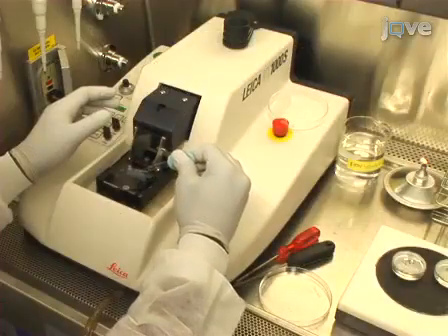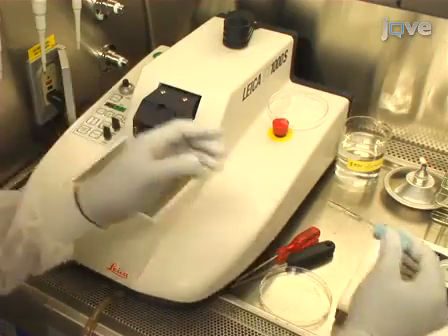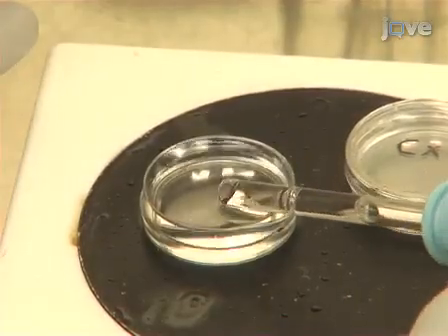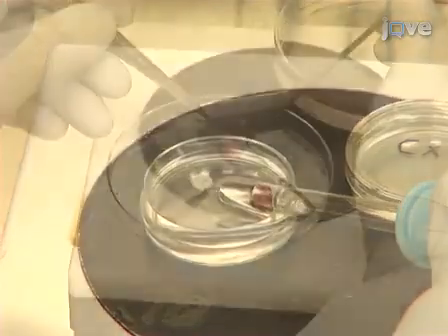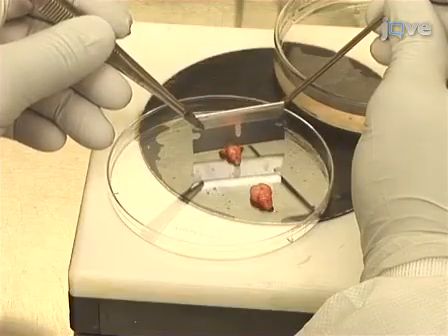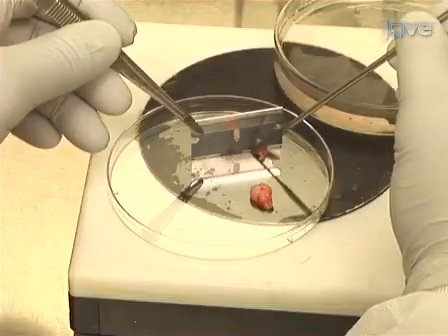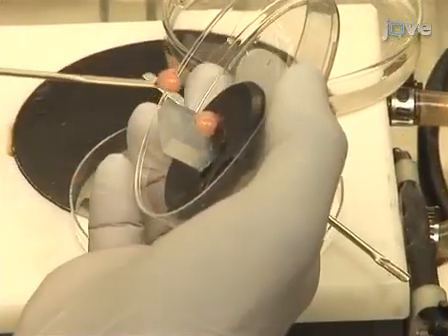Using an inverted Pasteur pipette with suction bulb, collect and transfer the slices containing the VTA into 35 by 10 mm petri dishes filled with sterile chilled gey's solution. For cortical sections, repeat the previous slicing steps but apply a vertical cut between the cortex and cerebellum, and mount the forebrains with the frontal pole up.